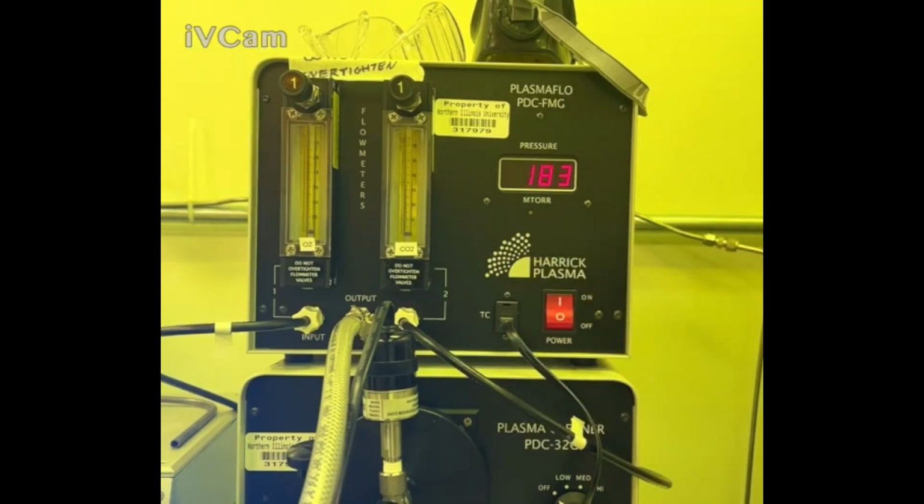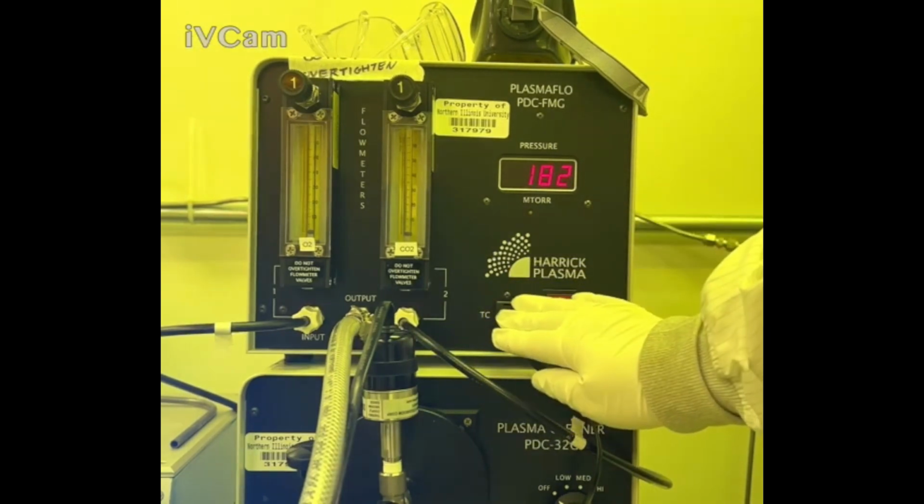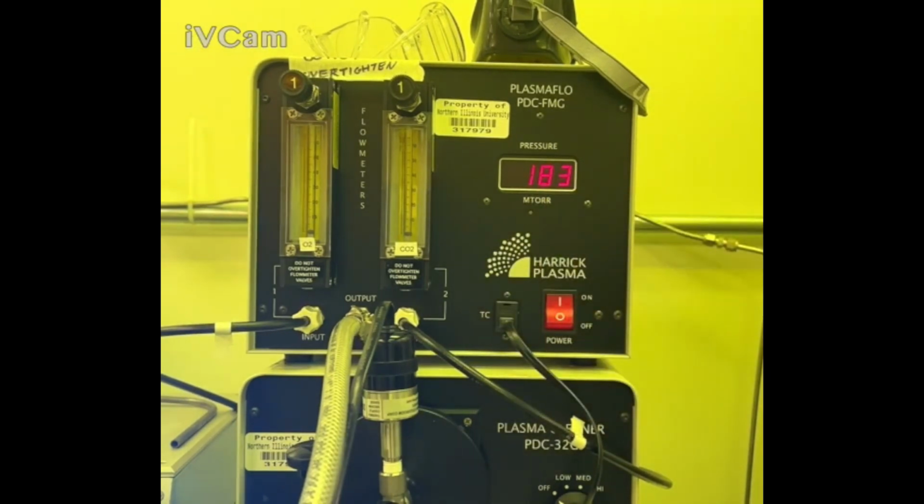Just be very gentle with this. Don't shove it in, just kind of lightly touch it. It might just be dislocated a little bit or not fully plugged in. Waiting for it to drop to 150 could take about 2 to 3 minutes, so just be patient.